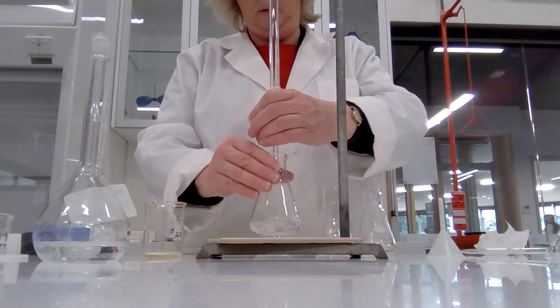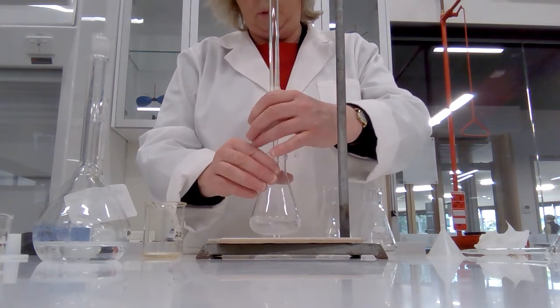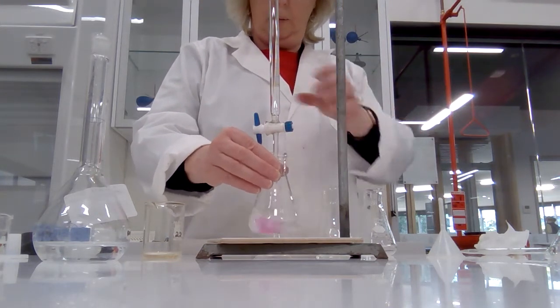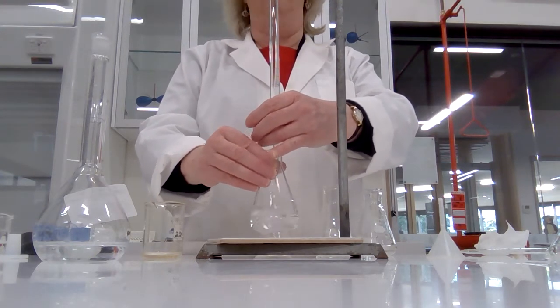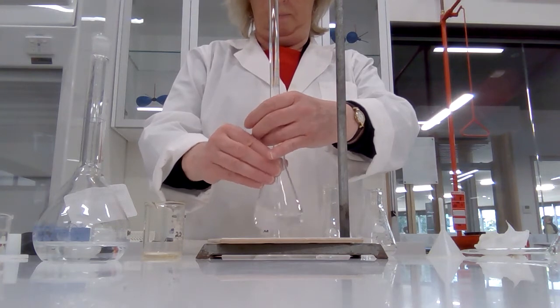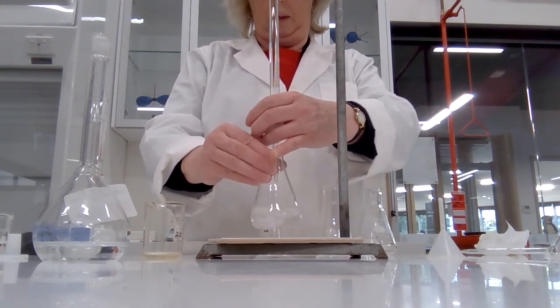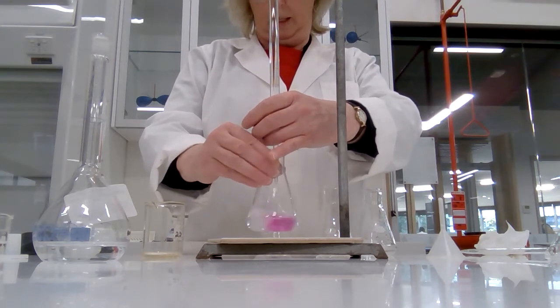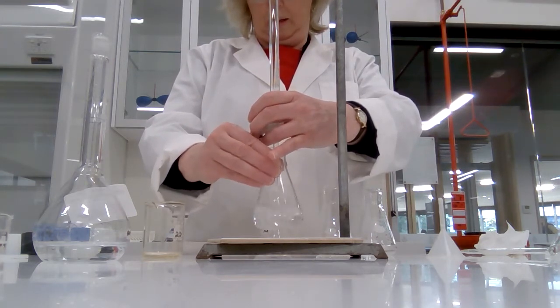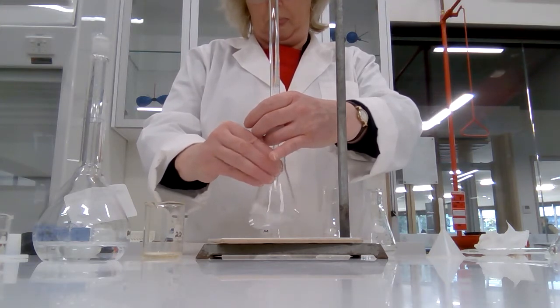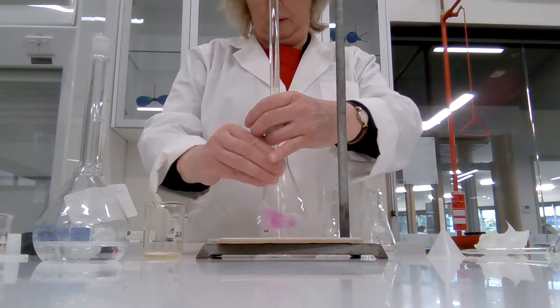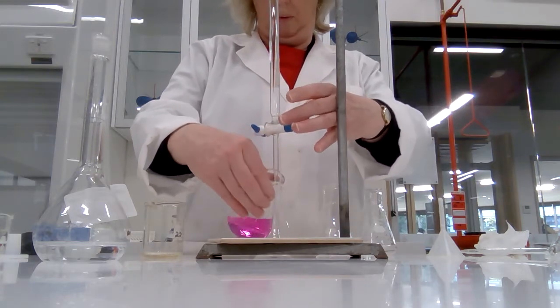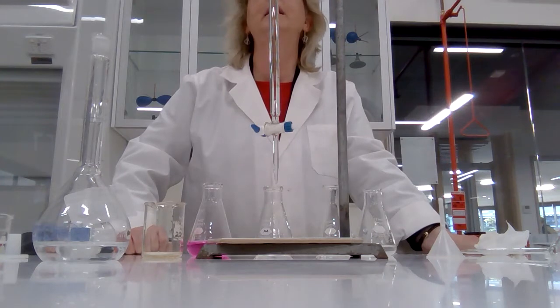Okay, away we go. Okay, it's going to be a small titration because it's already going pink. I'm not even up to 15 milliliters yet. This is good. And there it goes. Right, beautiful. That was 16.40.